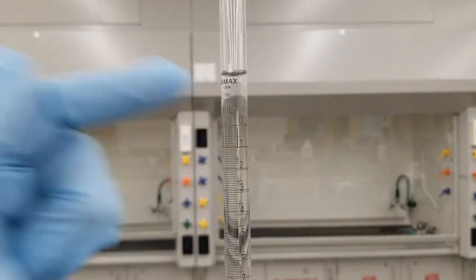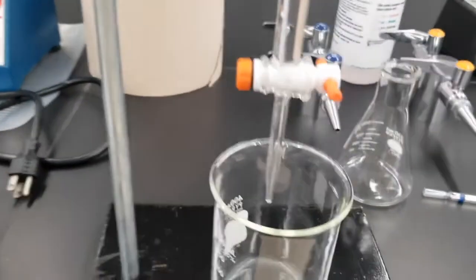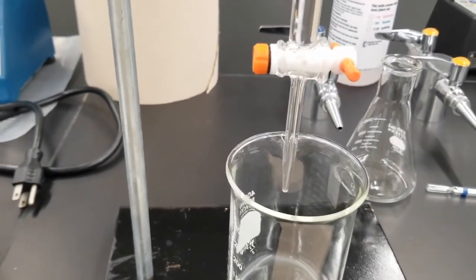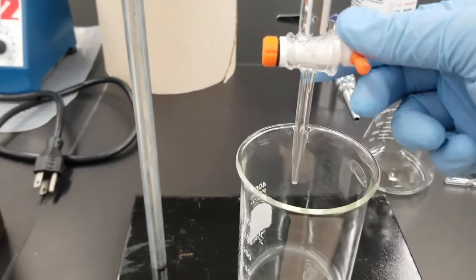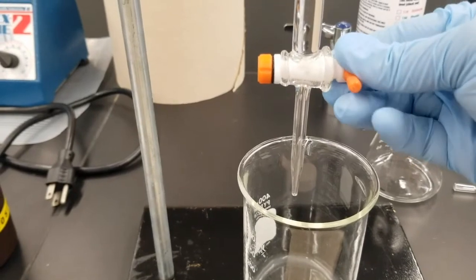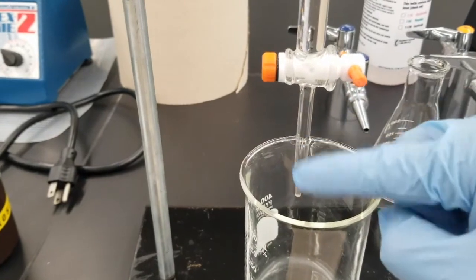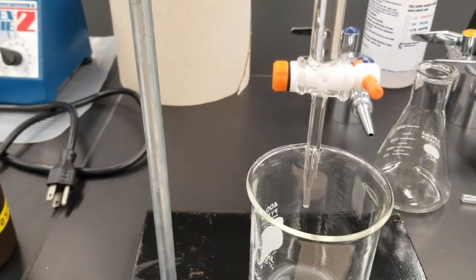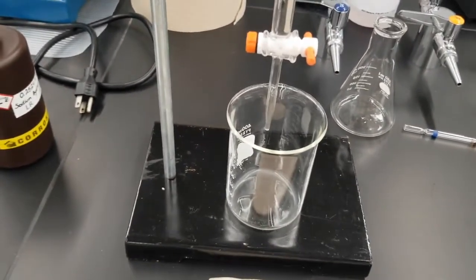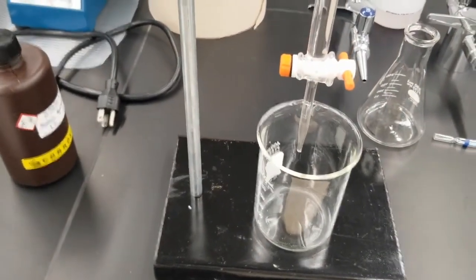Obviously I don't want that there for the actual titration, but I wanted to overshoot that because I want to get rid of the air bubble that's in here right now. Now, you can't really see that air bubble because everything's colorless, but hopefully once I turn this and run some sodium hydroxide through, you'll see that air bubble disappear. There you go. You can see it now looks a little bit different than when we started out. As long as we don't run out of sodium hydroxide, this air bubble is now gone, as long as we keep some sodium hydroxide solution in our burette.